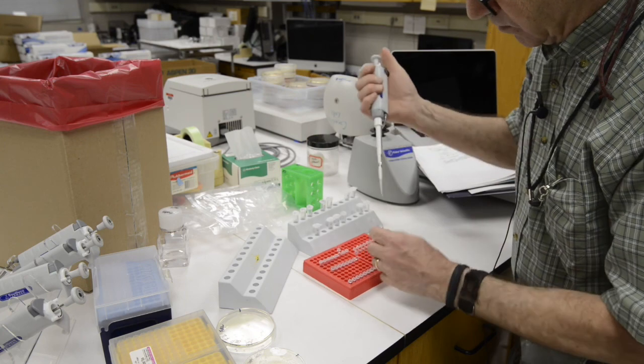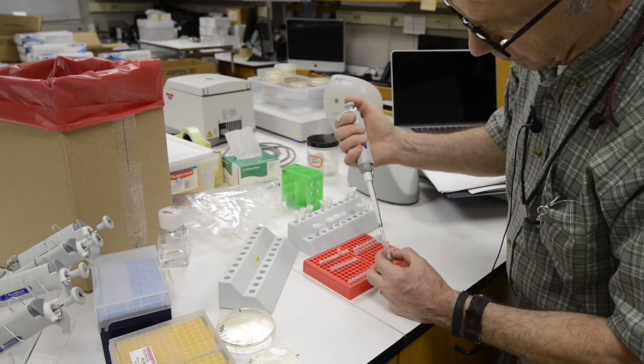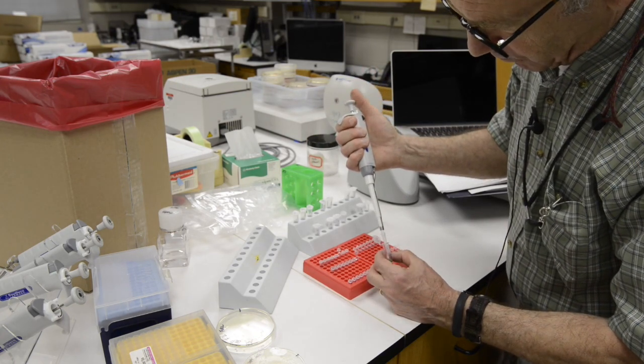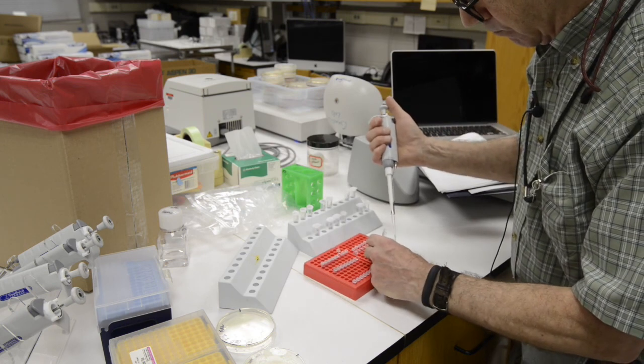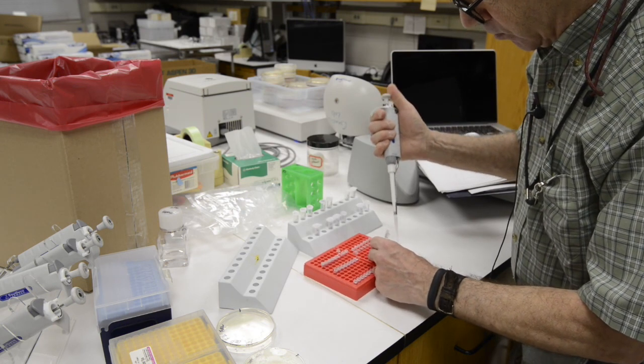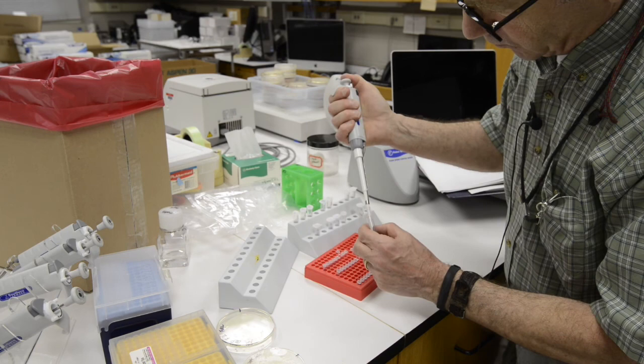In addition, your instructor will provide you with a small tube or a series of small tubes, 2 milliliter tubes that contain agar. And these are going to be for making stab cultures.